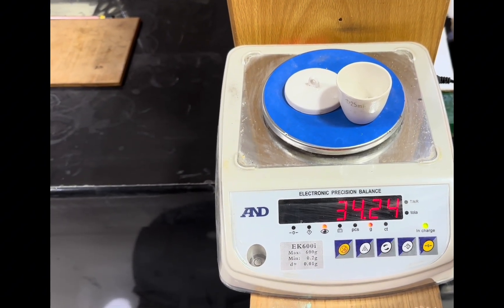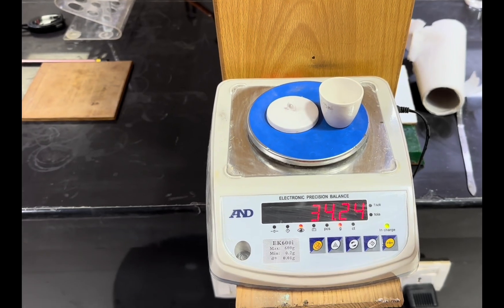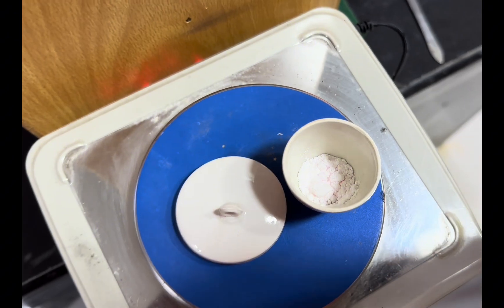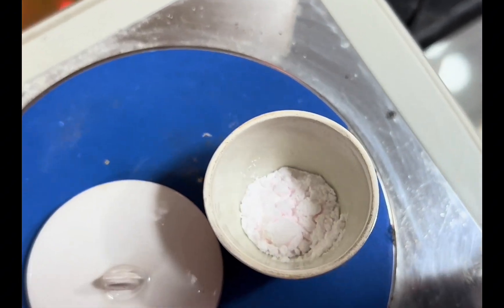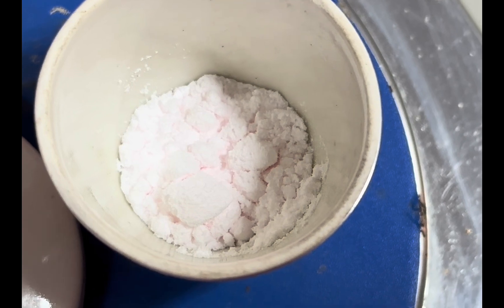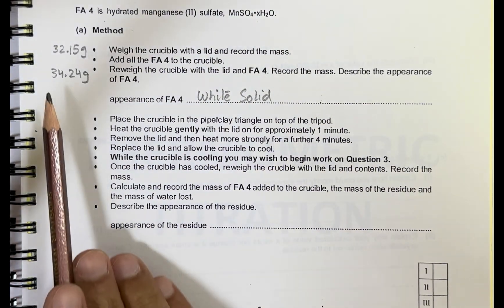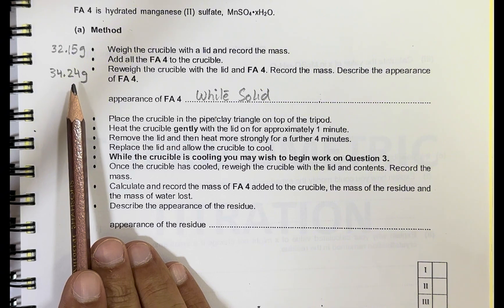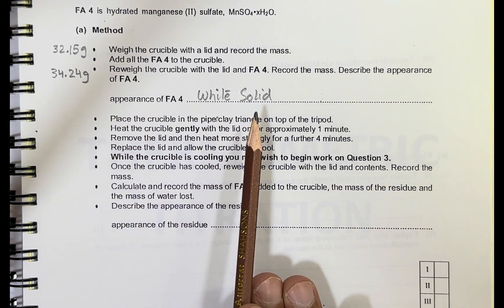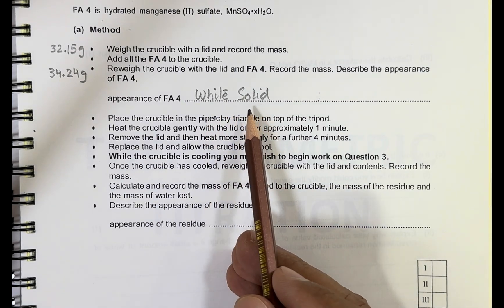The mass of crucible with the lid is 32.15 grams. Now add all the FA4 to the crucible, re-weigh the crucible with the lid and FA4, and record the mass. Also describe the appearance of the FA4. The mass recorded is 34.24 grams, and the appearance is a crystalline white to pink-white solid.